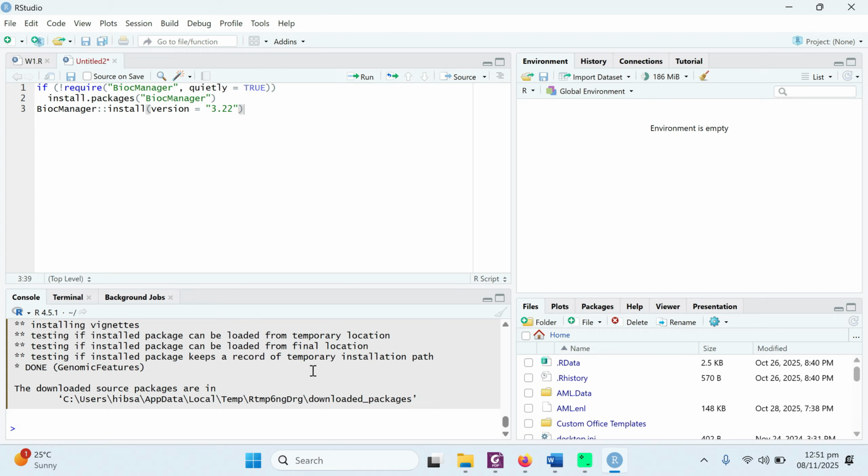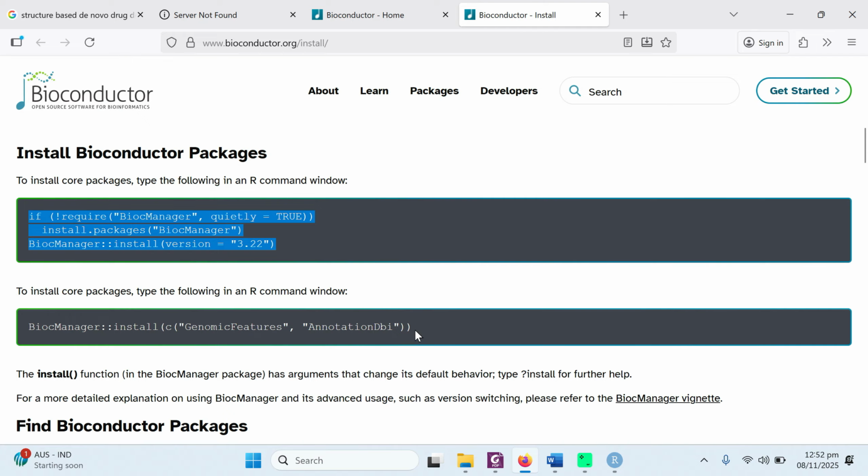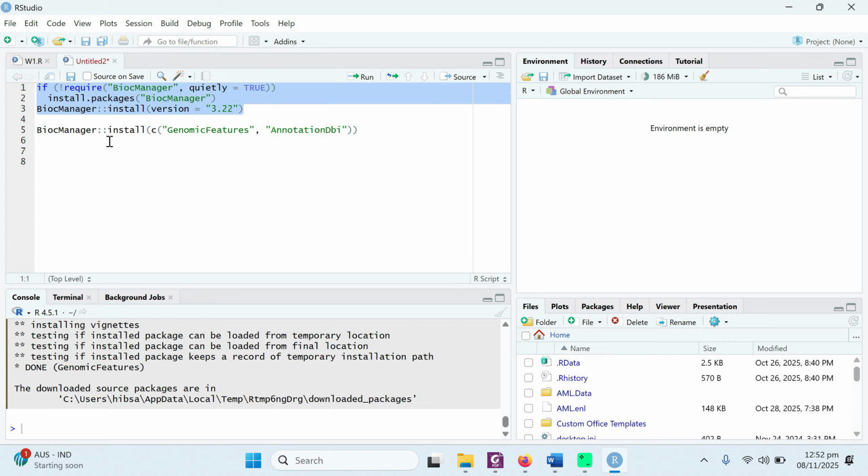Our packages have been completed, downloaded and installed. You can see that the downloaded source packages are in this location. There are also some core packages. If you want to install these core packages specifically, you can simply copy this command, go to RStudio, paste it, and you can install it. But these packages are already installed if you used the above command for installation.